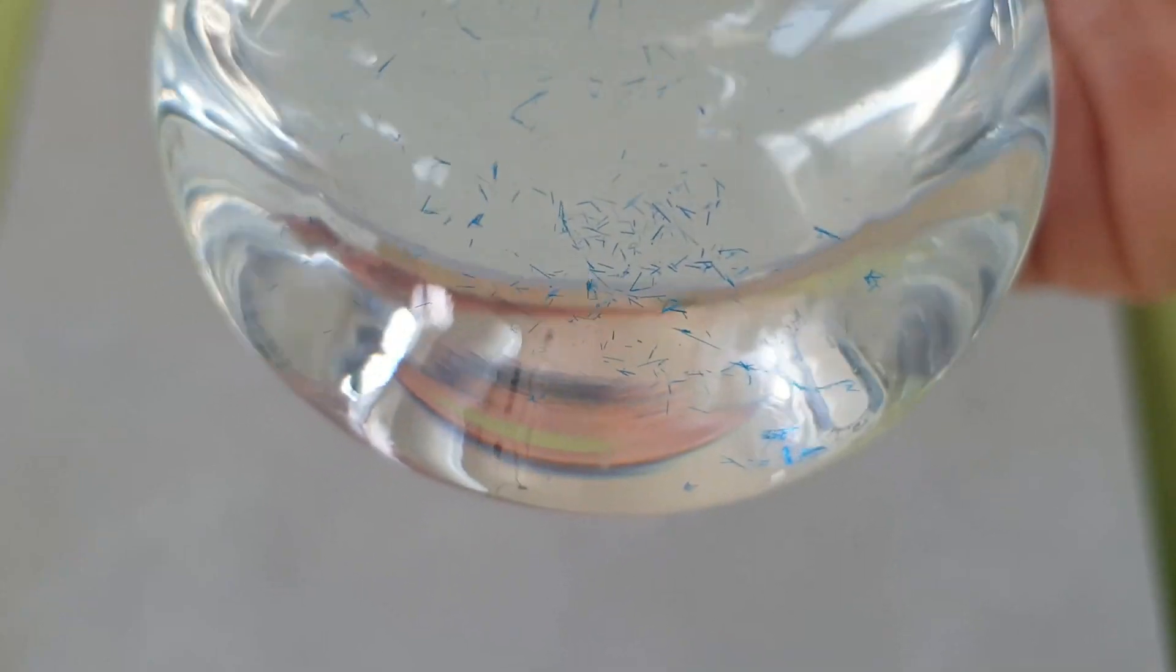I had a small amount of crystals left in the reaction vessel and it was very mesmerizing to look at them while they were submerged in ethanol.